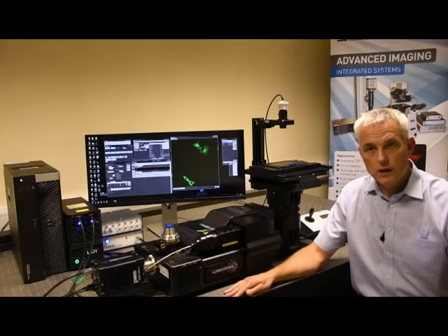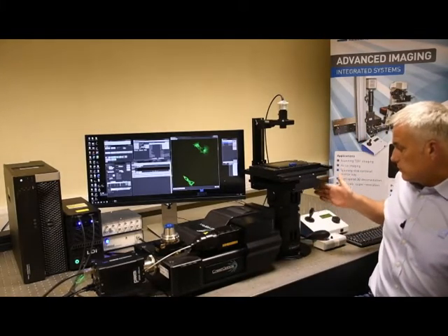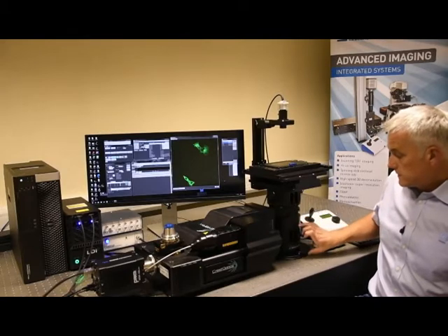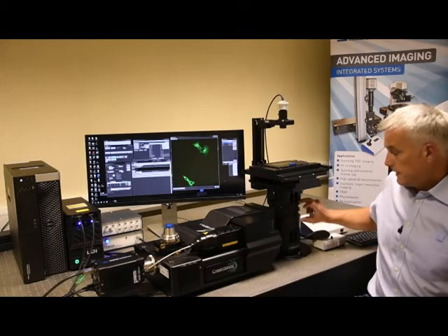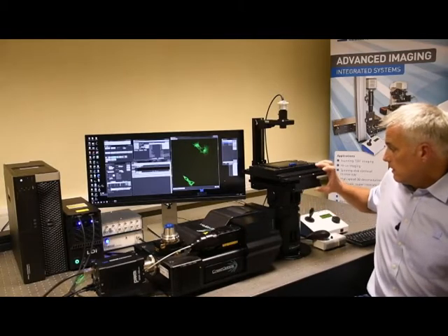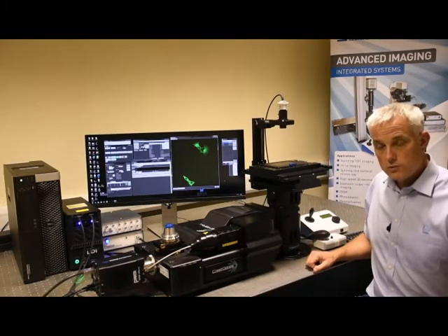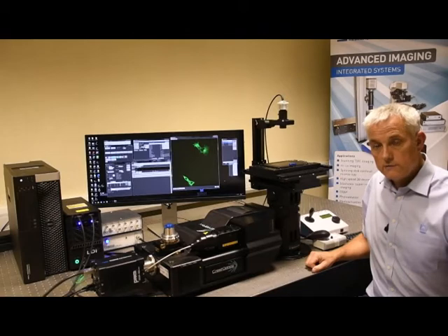First, I would like to give you an overview of the hardware that we're using for our confocal configuration today. We're using a Cairn open frame base configuration to couple the imaging hardware to. This consists of a detection layer, which has the left-hand side port coupled to the spinning disk confocal. It has an epifluorescence layer and a manual focusing layer. On top of the focusing layer, we have an automated XYZ stage from ASI that provides motorized XY positioning and a fast piezo Z scanning through Z of the sample.